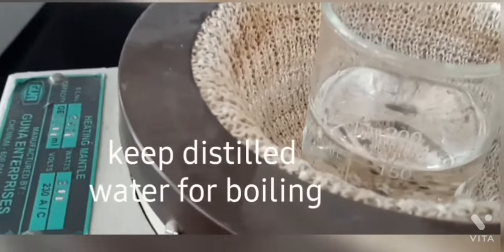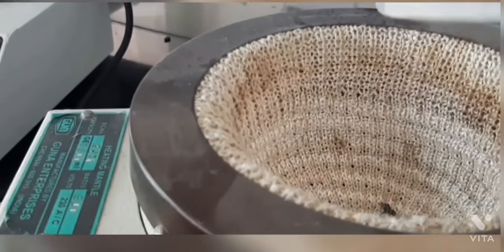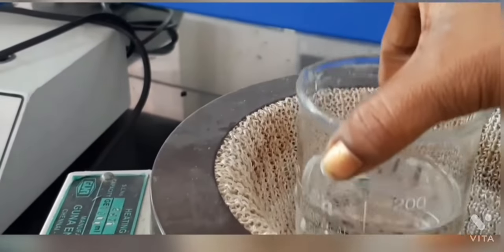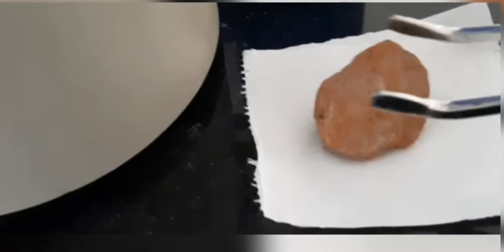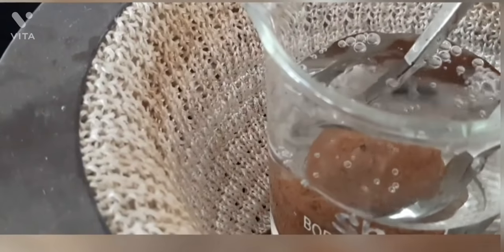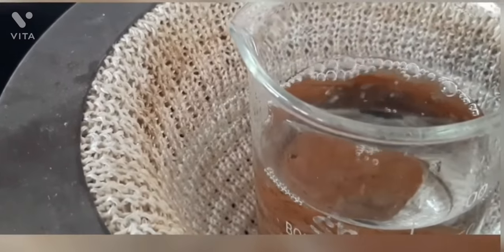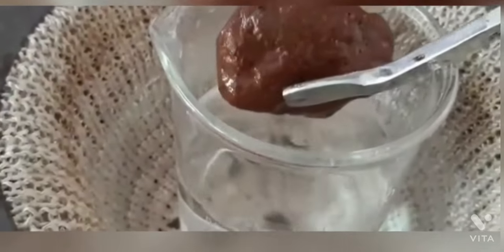After knowing the weight of the sample brick, it must be boiled in distilled water for at least 15 minutes to fill up all the pores present in the brick. Distilled water is taken in a 250 ml beaker and placed in a heating mantle. When the water starts to boil, the sample brick is carefully dropped into it using tongs, ensuring the brick is completely immersed. After boiling for at least 15 minutes, it is carefully taken out using tongs and placed on a tissue paper.